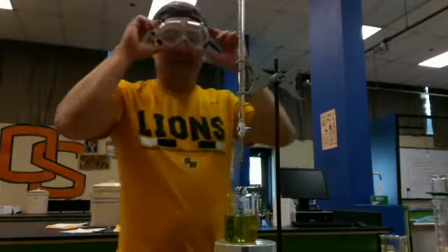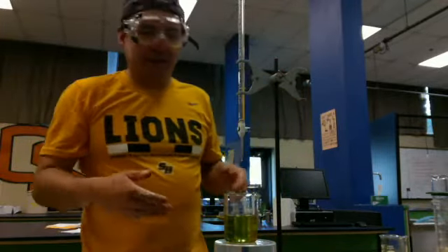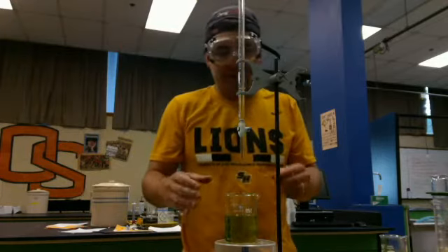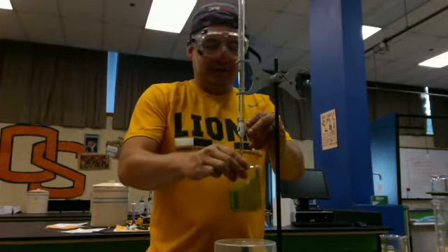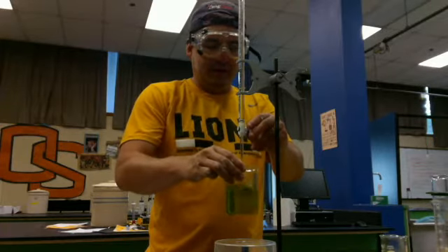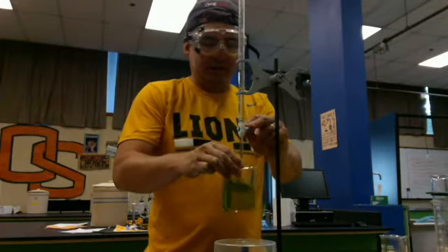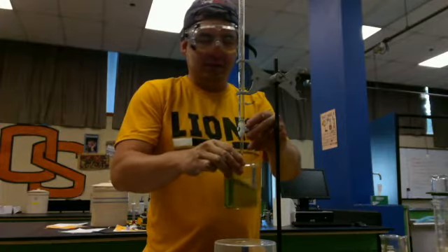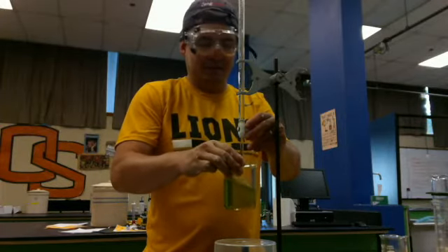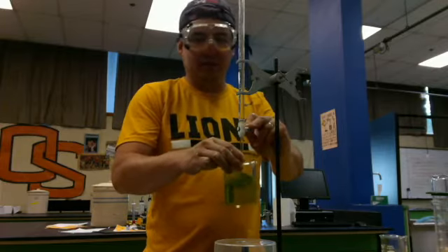So a good chemist would note the starting. And actually I can go down to the hundredths because it's right on the line. So that's 10.00 milliliters. And the way I do this, I'm going to titrate to the equivalence point. Now the equivalence point is where this is going to turn to that purplish color. So what I do, I slowly open. A lot of times we use stir plates, so that we don't have to swirl. We would use nicer glassware than this even. But again, this is just for demo.